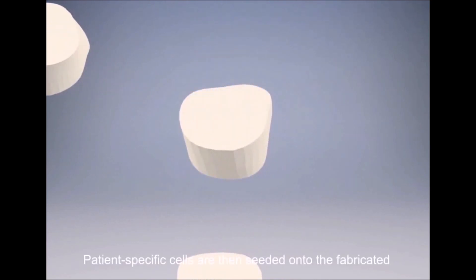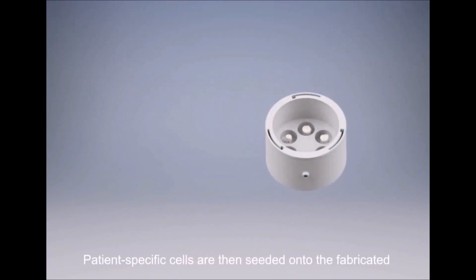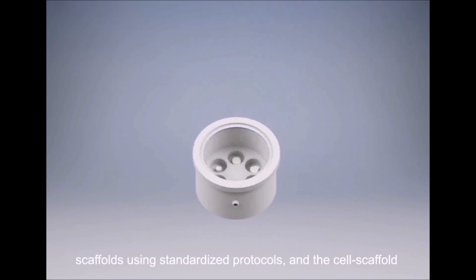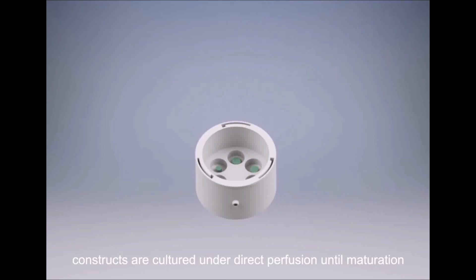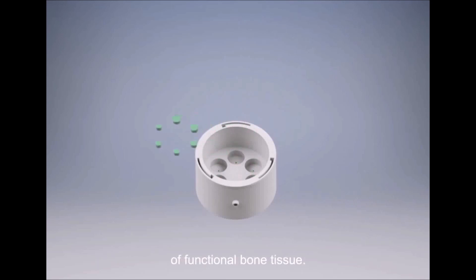Patient-specific cells are then seeded onto the fabricated scaffolds using standardized protocols, and the cell-scaffold constructs are cultured under direct perfusion until maturation of functional bone tissue.